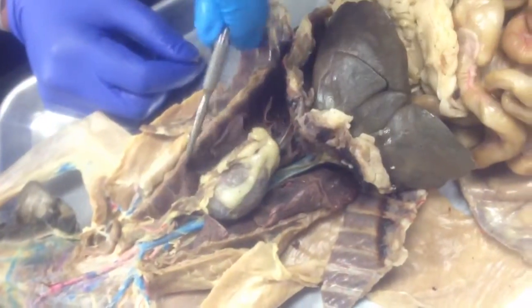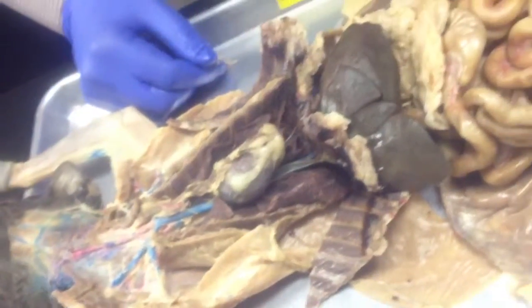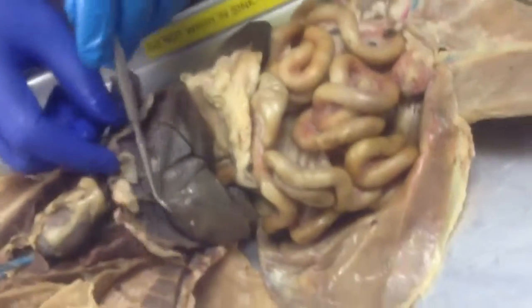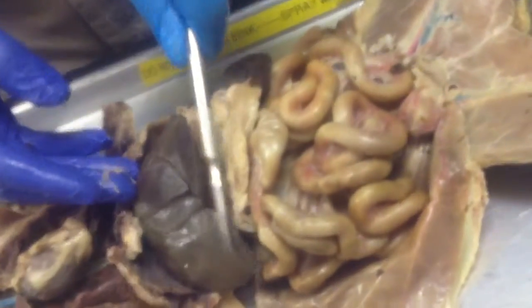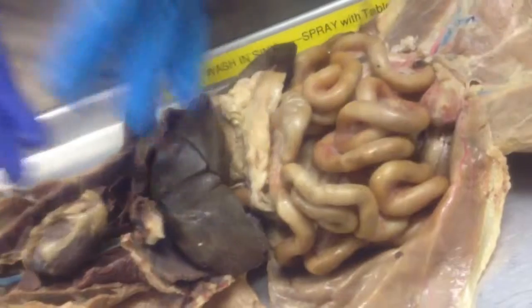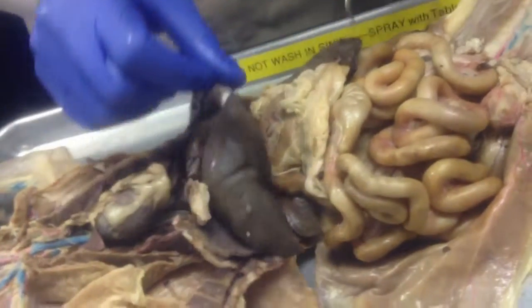So we see they're broken into subdivision, those are called lobes of the lungs. And down here, our first organ is the liver. So very big, relatively larger than human when you come to the relative size of the cat to the size of the liver itself. So that's the liver.